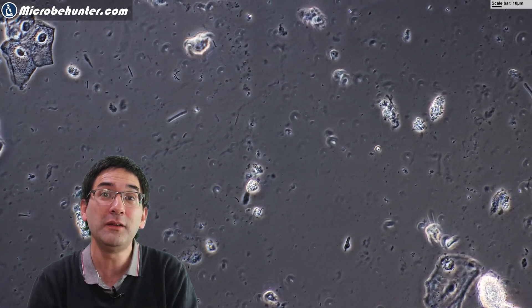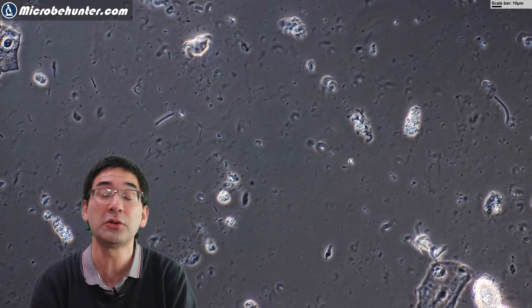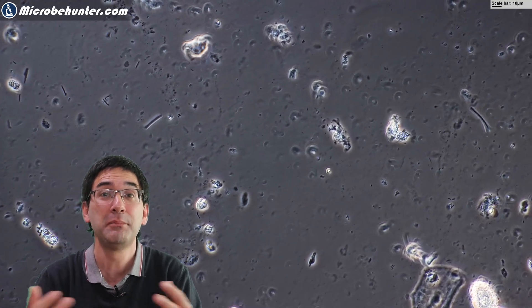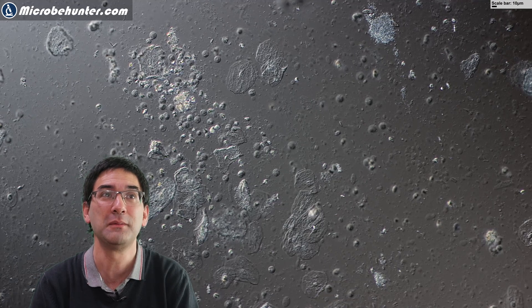Now, many of the things that are found inside the mucus cannot be identified. It could be material from my own body, like cell debris, or it could also be dust and dirt fibers — something I have not seen yet. Maybe it's a little bit too early in springtime; I have not found any pollen yet. But plant pollen, of course, should also be visible.